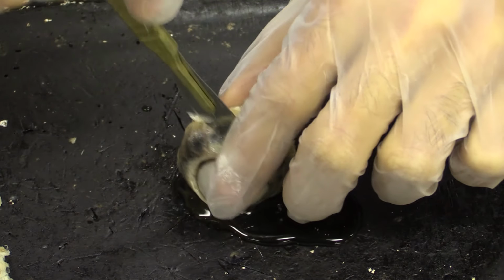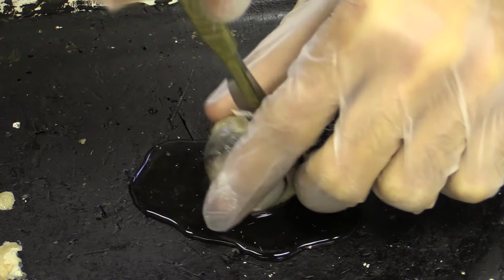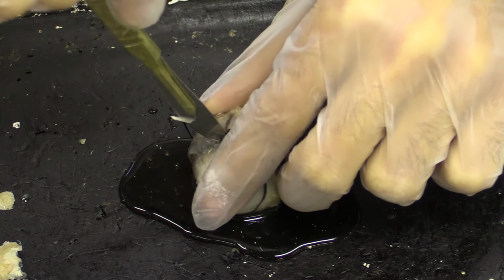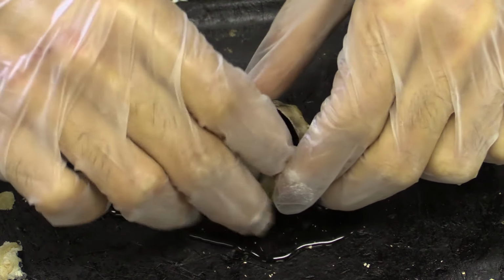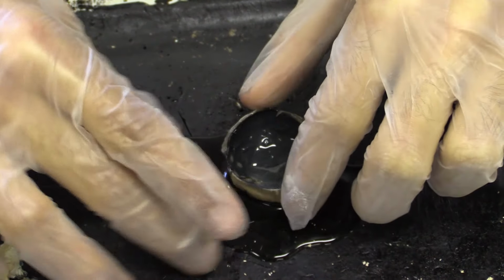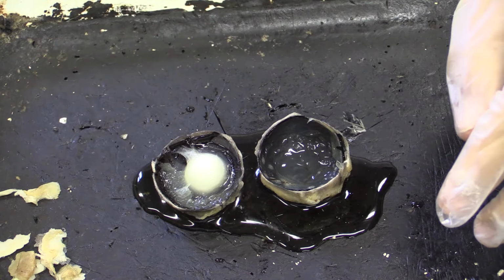Keep cutting, all that liquid is aqueous humour. And as I said, it's quite difficult to cut into the sclera because it's made out of a fibrous sort of structure. Okay, put the scalpel away. And here we have the 2 halves of the eye. As you can see, I didn't actually disturb any of the structures, which is quite important.